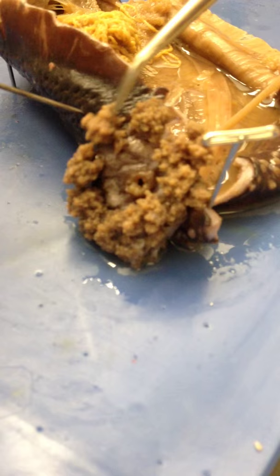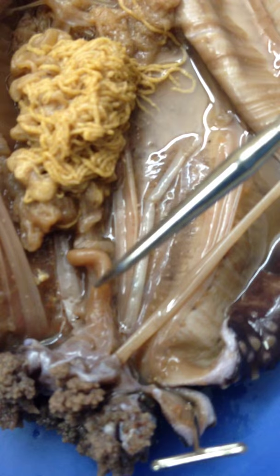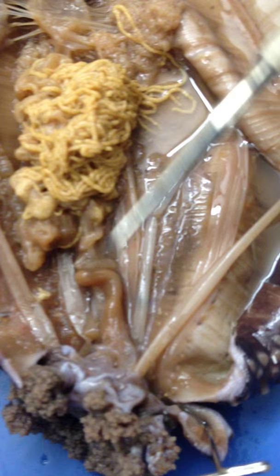And these are tentacles. Yep, tentacles. Through the other side of the mouth is the pharynx right here, this sort of swollen, bulby thingy. And then the esophagus is right after that. And then we're being told that somewhere after that is the stomach, so it's probably this little curvy area right here.